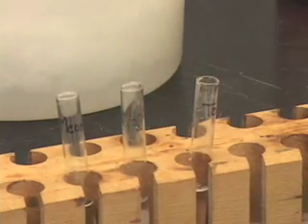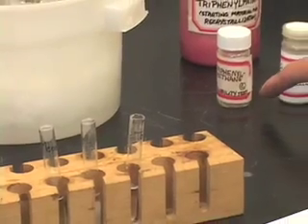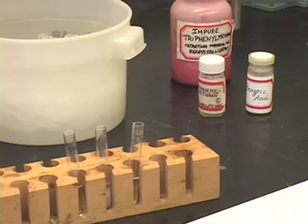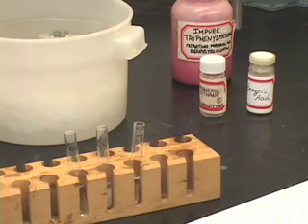What you are going to do, of course, is use standard triphenyl methane. Do the solubility tests in the same way that I performed just now and come up with the suitable solvent for recrystallizing your impure triphenyl methane.